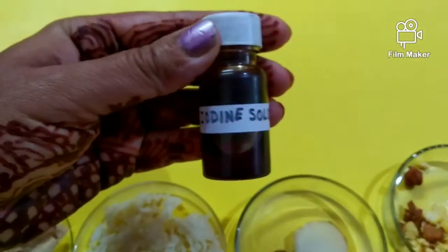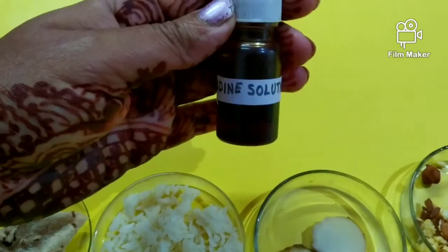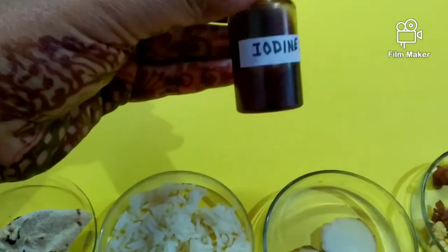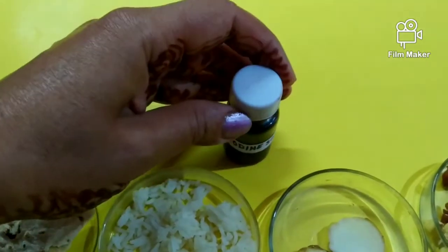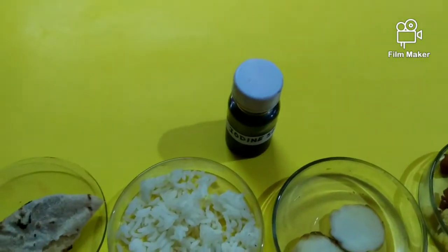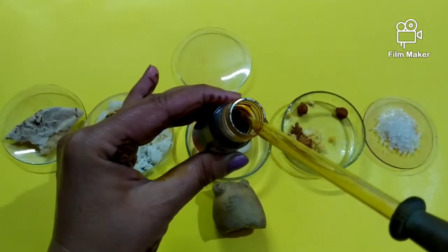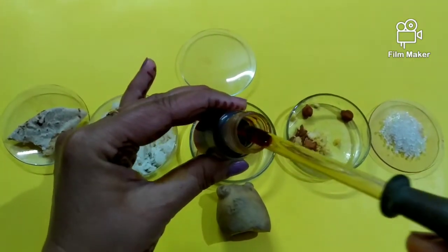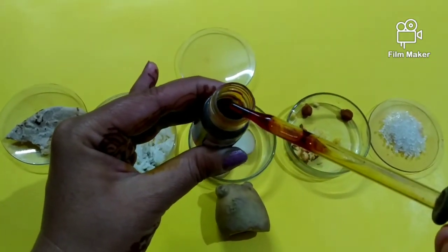This is iodine solution, and with half a dropper we will pour some drops over the samples which we have taken. The color of the iodine solution is dark yellow, as I can show you here.